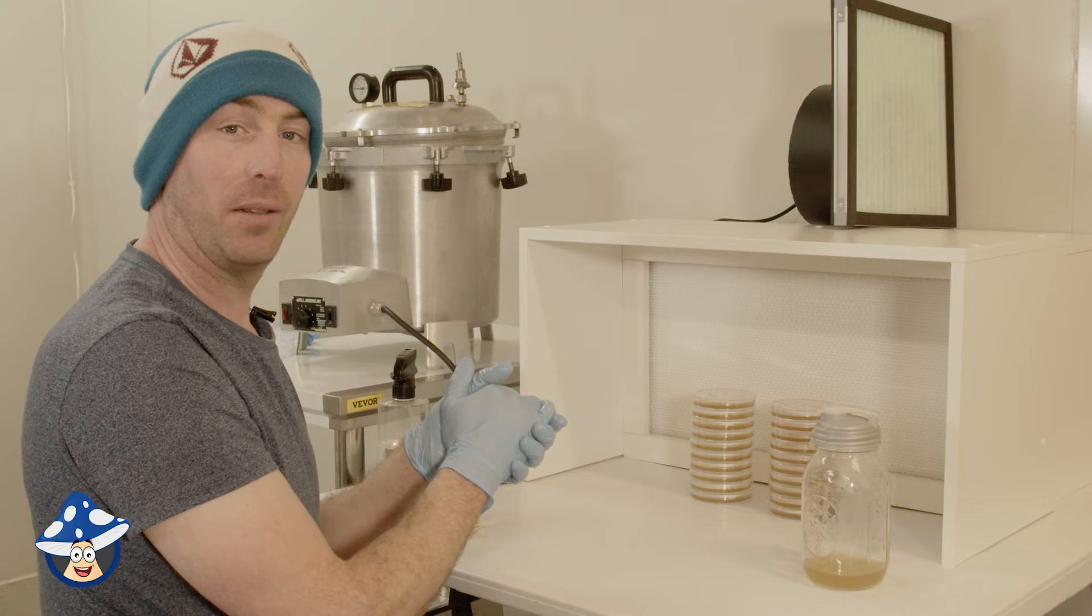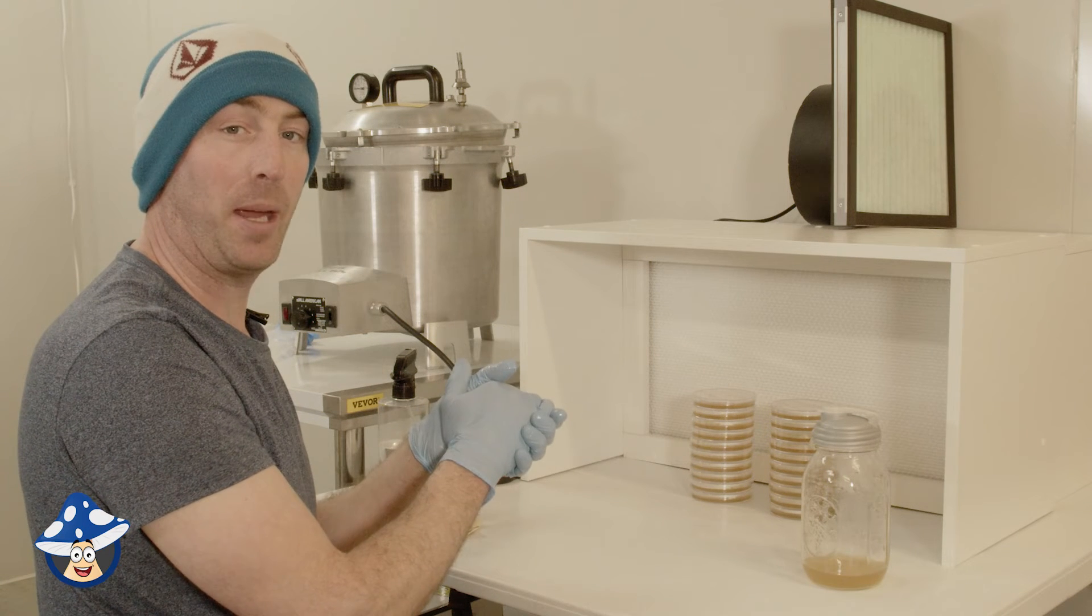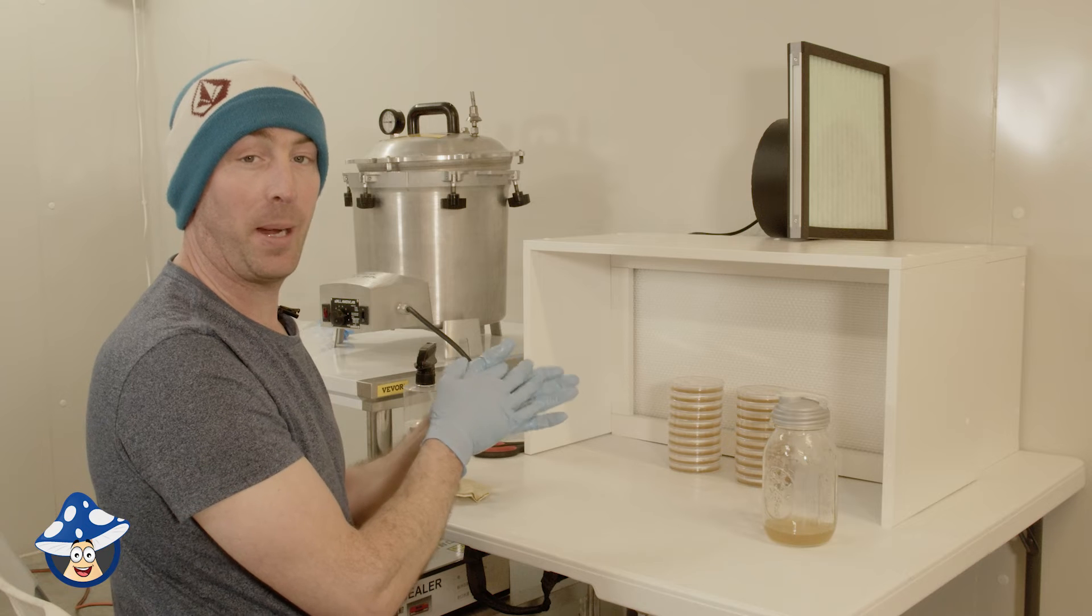Once they're cooled and set, we'll put them in some ziplock bags to keep them in a sealed bag for when we need to use them. Let's check back in when they're cooled down.